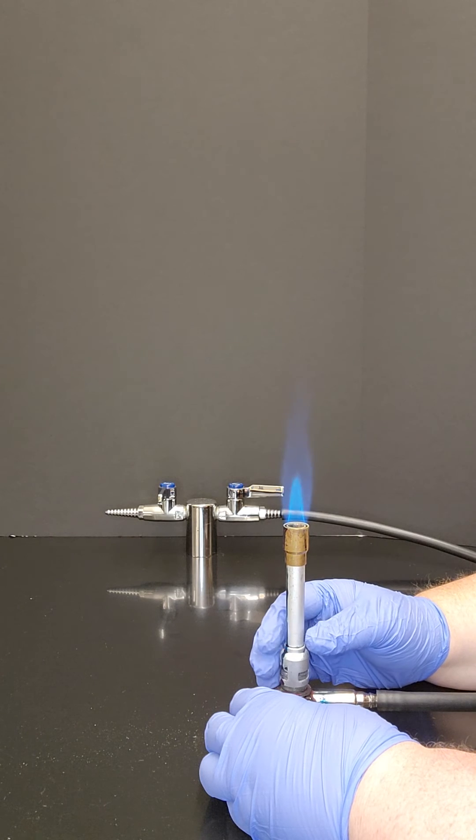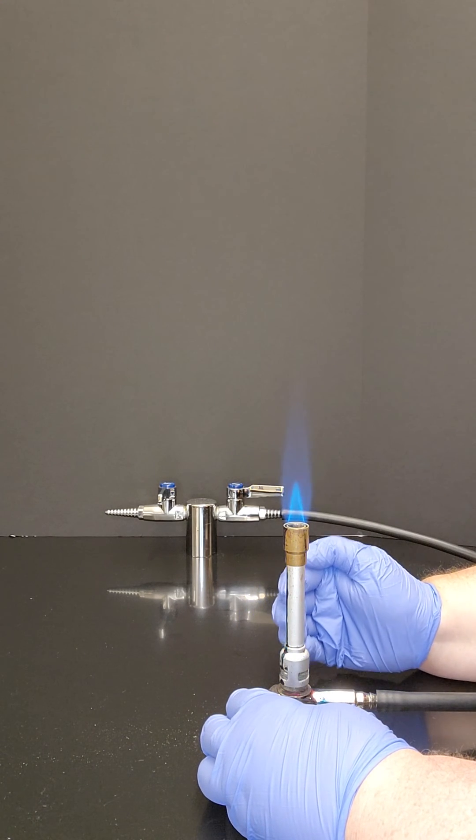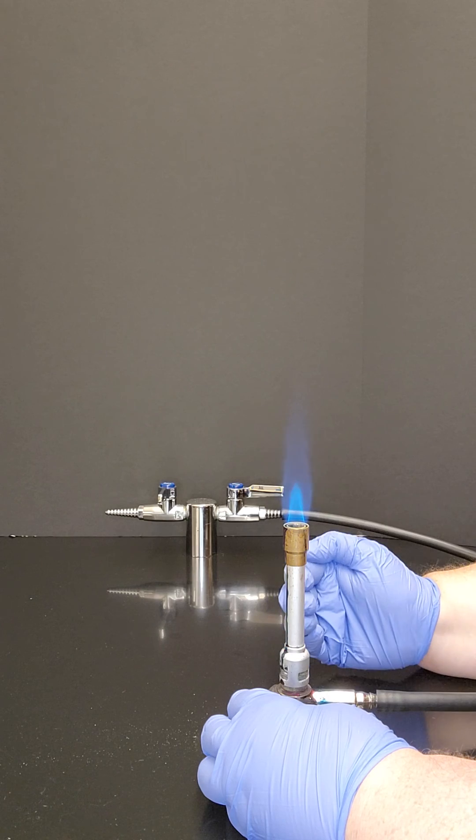Turning it to the left feeds it more air. Your flame needs both air and fuel to burn properly.